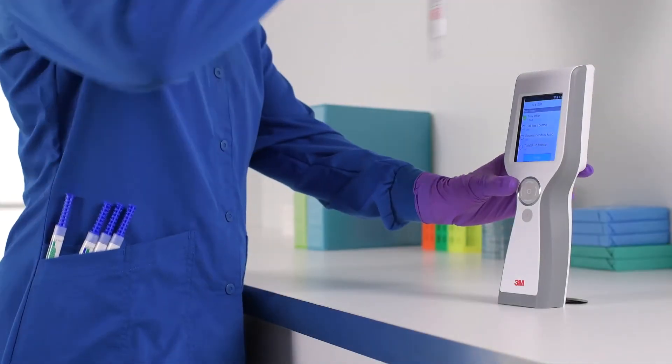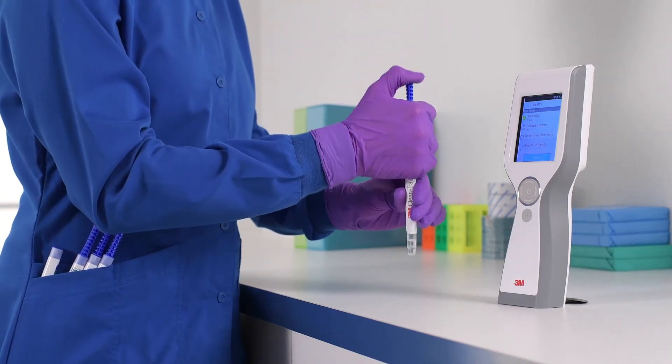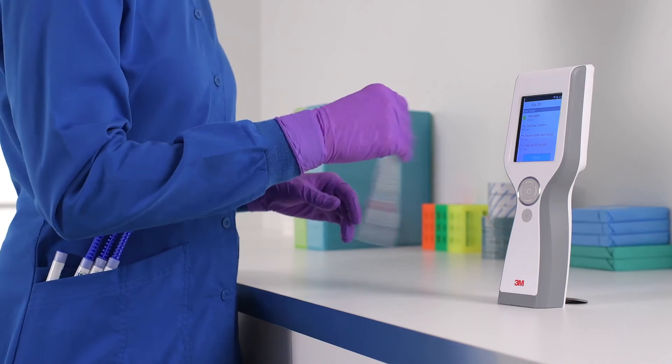You'll follow the same click and shake steps to activate any additional ATP tests and the same steps to measure your results using the luminometer.